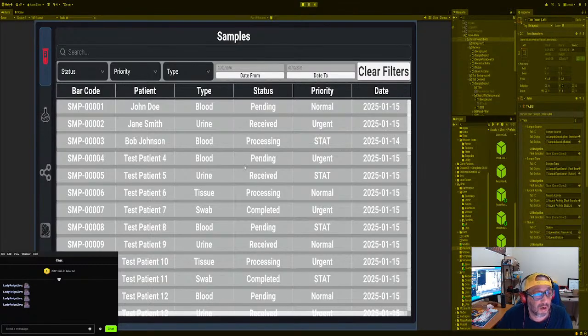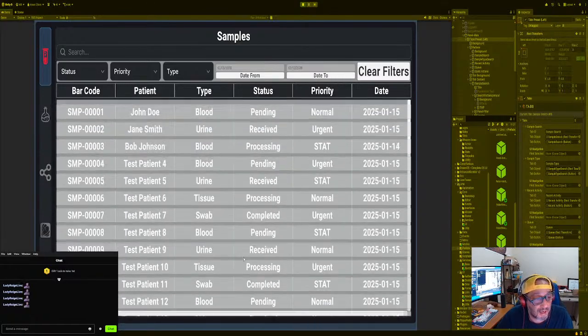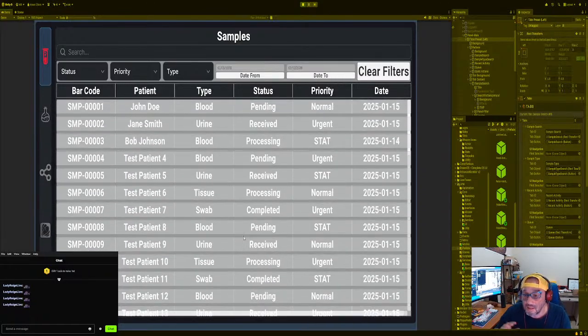So anyway, here we go. It's nice. As you can see, everything is nice and neat, very aligned and all that, right? If you want to change this stuff, we're going to add a quick menu today also, so you don't have to. I'm going to show you straight.